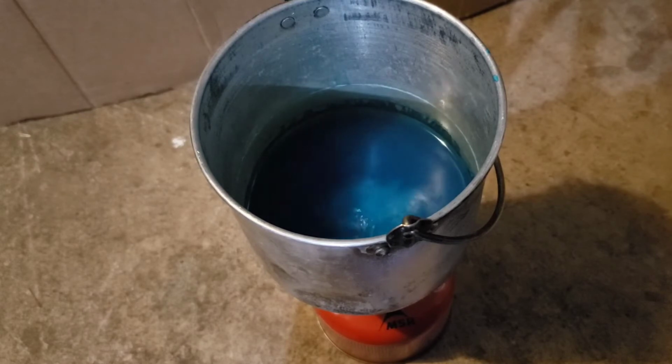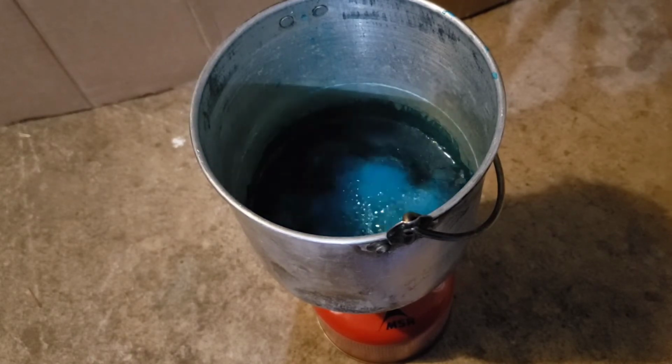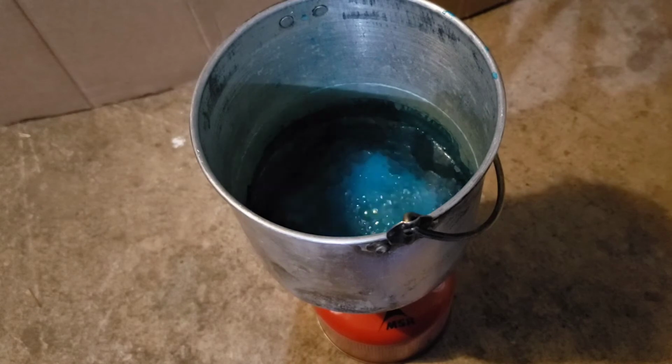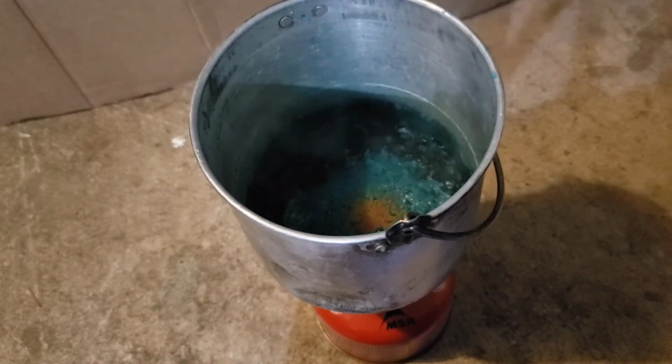I was literally just precipitating out copper again, and had done this for literally nothing, and it's such a simple reaction, and that's just such a dumb mistake to make, so I still kind of kick myself for that. And so as you can see here, it looked like it was going fine for most of it, but towards the end of it here, you can see I slowed the time lapse down a little bit, and you just get copper out.